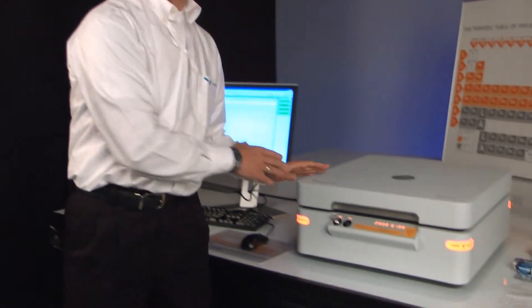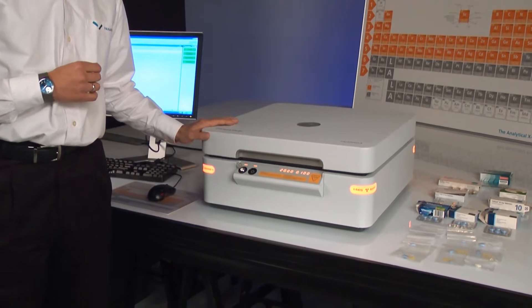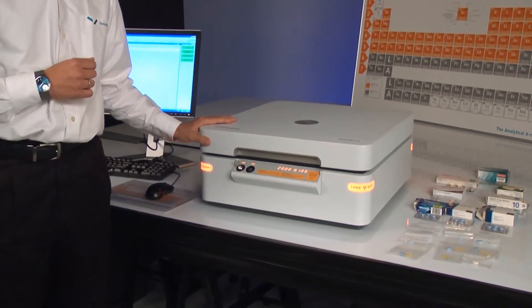Today however, I'd like to demonstrate another use: whole tablet identification using the fingerprint method. For this exercise, we're going to use a Panalytical EDXRF Epsilon-3 spectrometer.